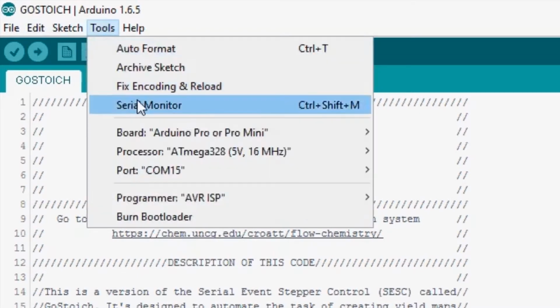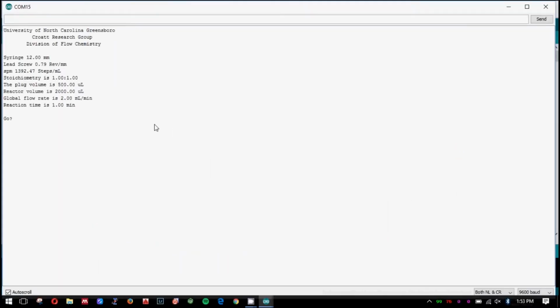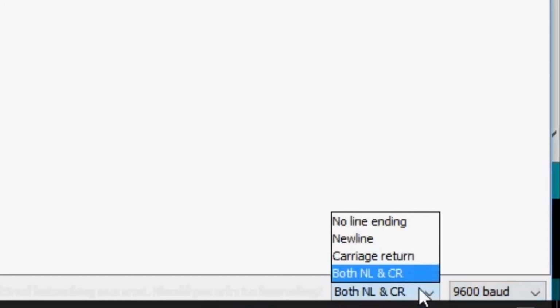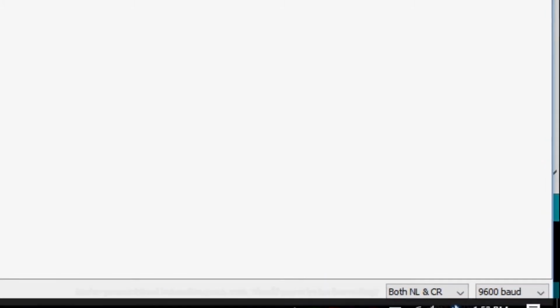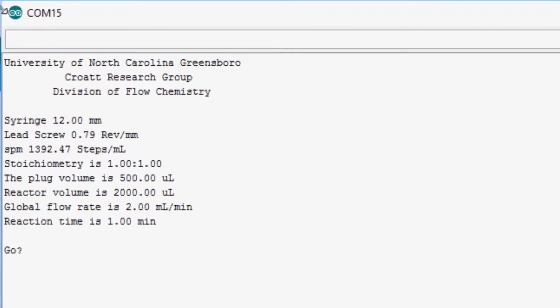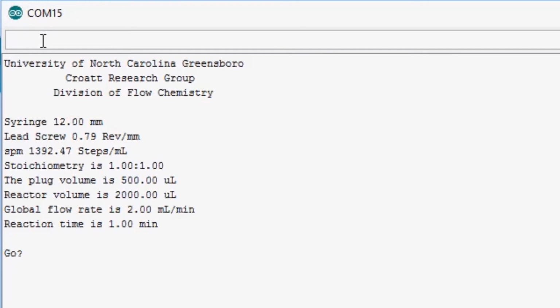Alright, upload the code to your microcontroller, and with it still connected, open the serial monitor by going to Tools, then Serial Monitor, or by pressing Ctrl-Shift-M. Select a baud rate of 9600 and enable New Line and Carriage Return. You should be prompted by a splash screen along with relevant variables and their default values. As the user, you can control the program by typing commands using the following syntax.